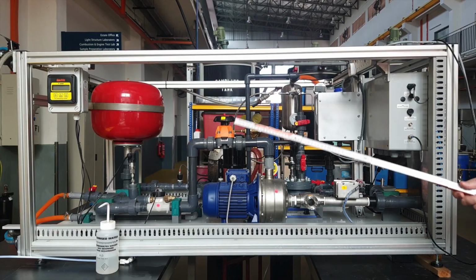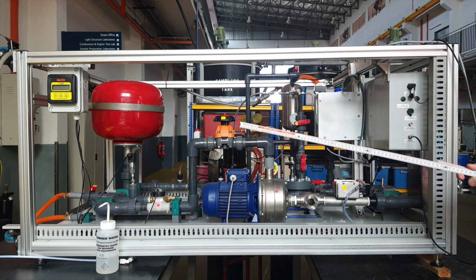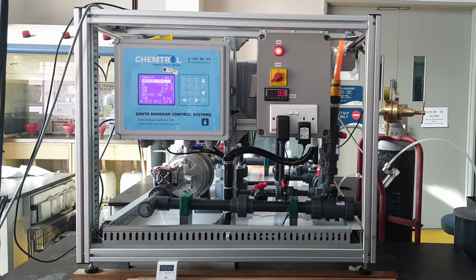Good morning. Today we'll do a short run on the test rig. Let's go inside. So this test rig is a gas, liquid, solid volumetric analysis unit with constant mixing and online analysis. Today we're going to run a short run on the test rig to demonstrate its main operating features.